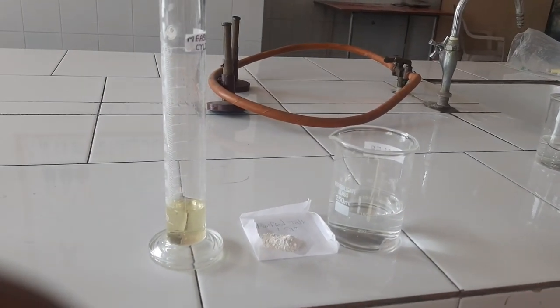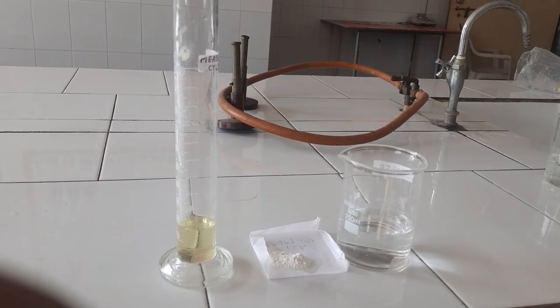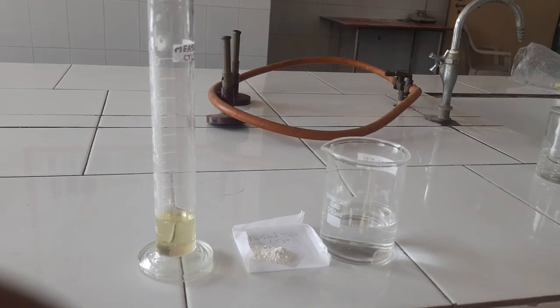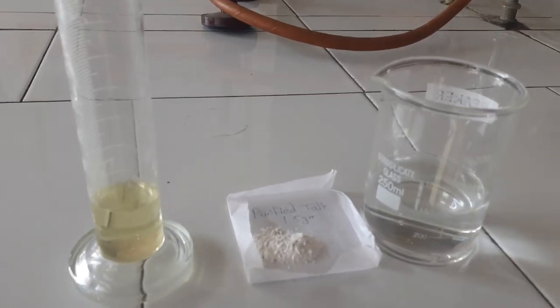Weigh quantity of chemicals required. Alcohol 90% 18 ml, purified talc 1.5 gram and quantity sufficient purified water 30 ml.